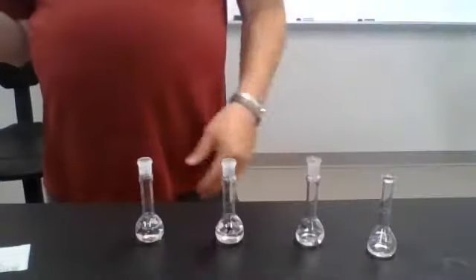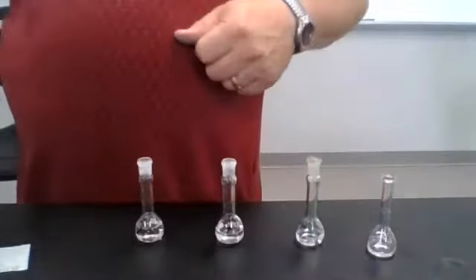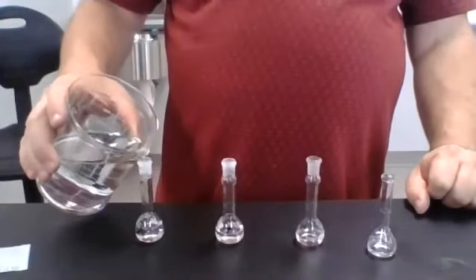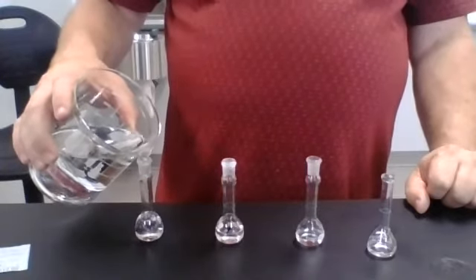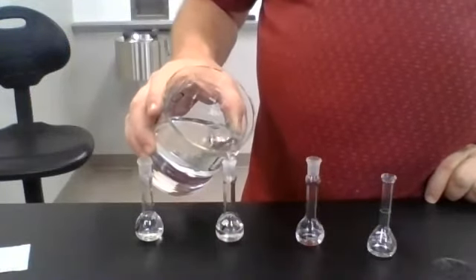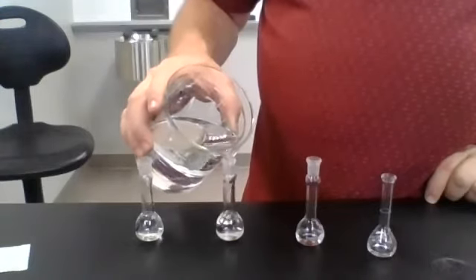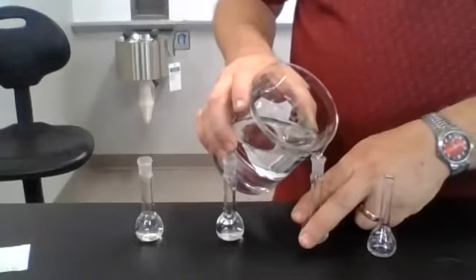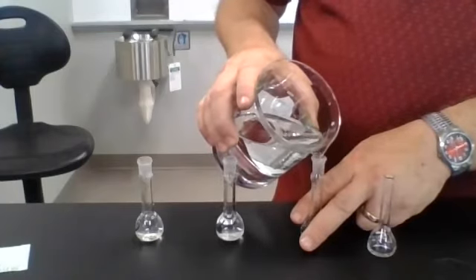I need to add to them some of the nitric acid. And I am going to do this a little bit carefully here. I'm going to pour a little bit here. And then I will finish off by using my pipette. Since I have that pipette tip already, I will probably use that to finish it out and to get it to the lines. See if I can do this without spilling or making a mess. And the answer is probably yes, but I might make a mess anyway.